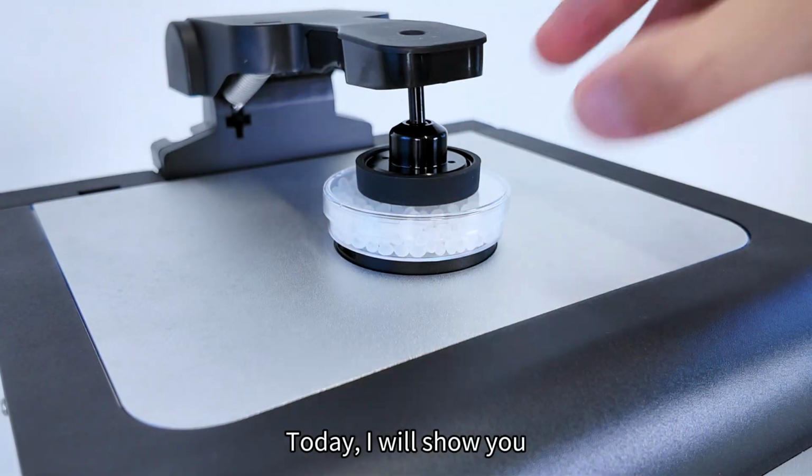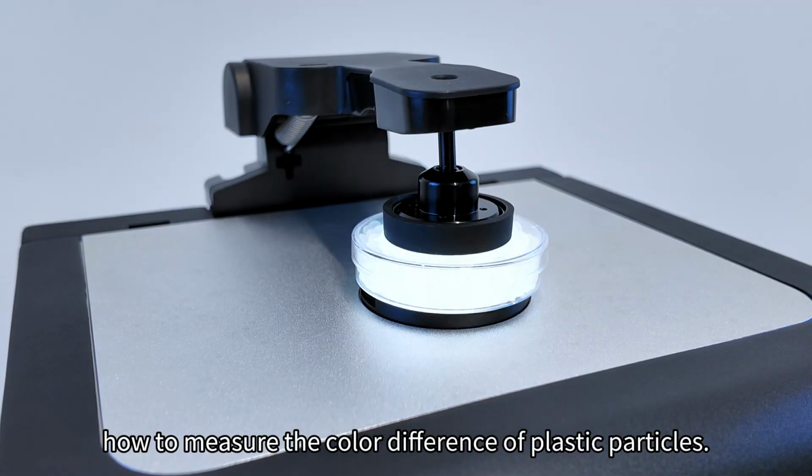Today, I will show you how to measure the color difference of plastic particles.